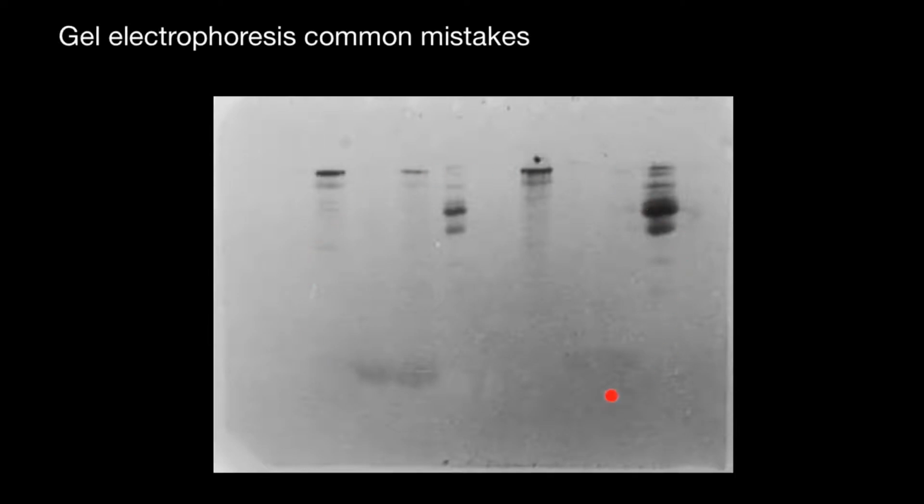This is one of the more disappointing symptoms you might encounter. Let's say you were extremely meticulous, did everything perfectly and ran your gel so that the dye front was perfectly even and right at the bottom. You rinsed the gel in deionized water, then left it on the shaker. Being late in the day, you forgot to replace the water with a stain. It was stained the next day, but here is the result.